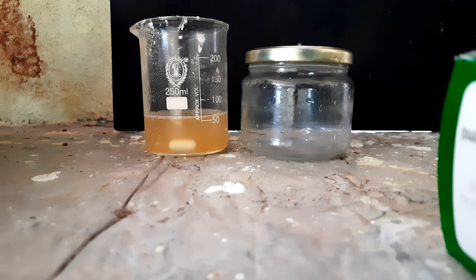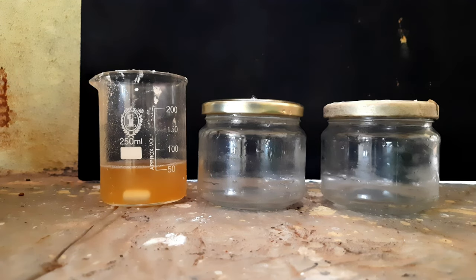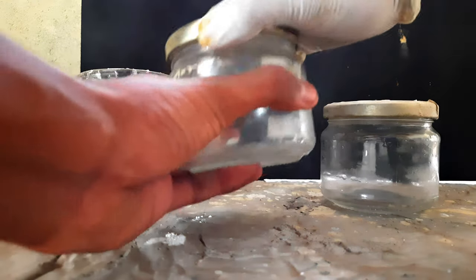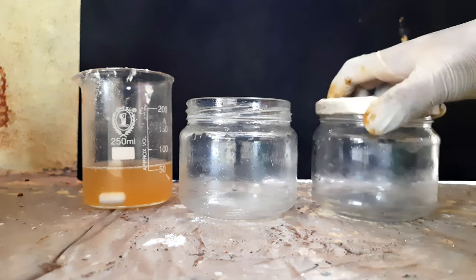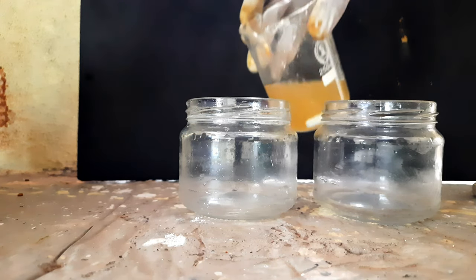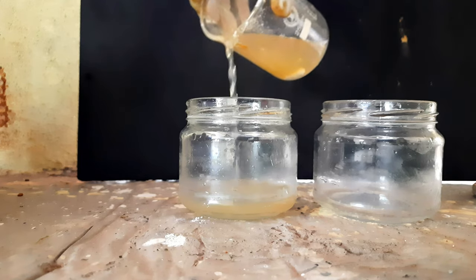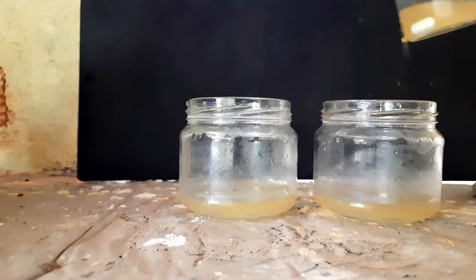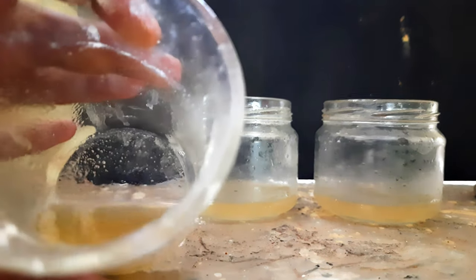I've taken two jars — people actually use petri dishes, which are small glass utensils that can be autoclaved. Autoclaving is sterilization — it kills all other microorganisms so you can grow only your desired microorganisms on the culture. But that's a different story. I'm going to be using a few milliliters of the solution into the jars.